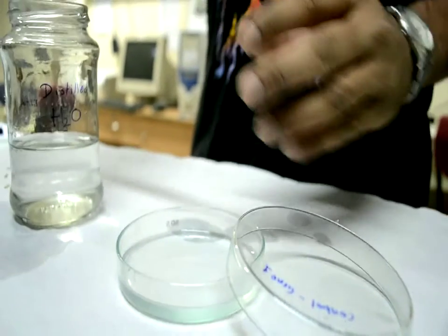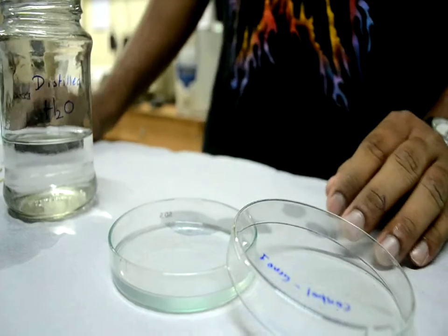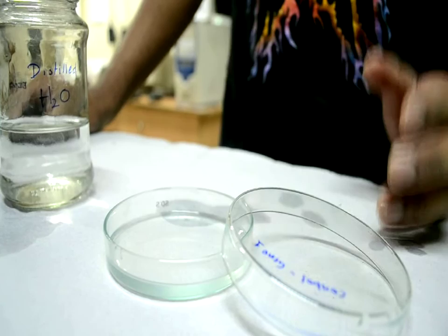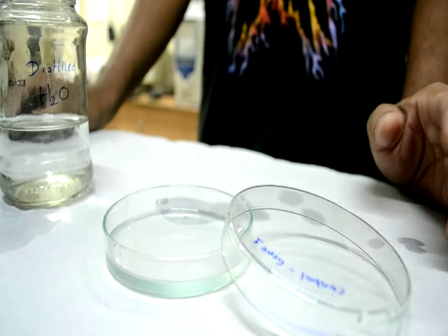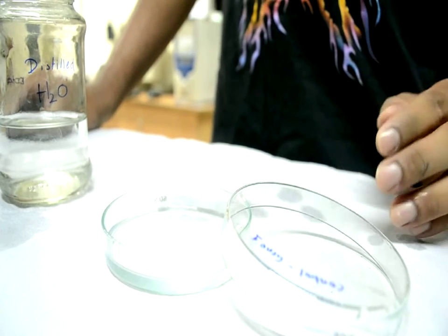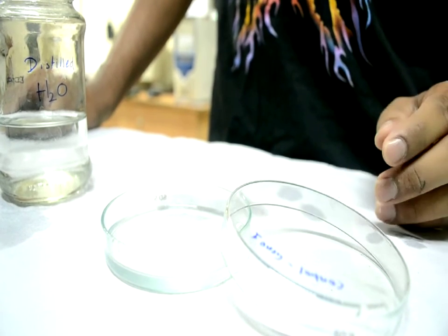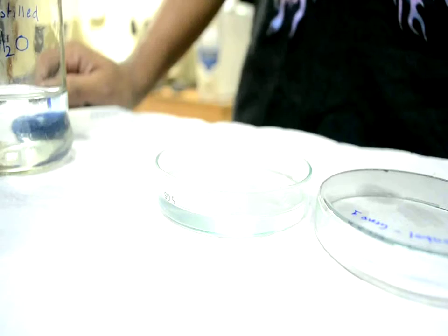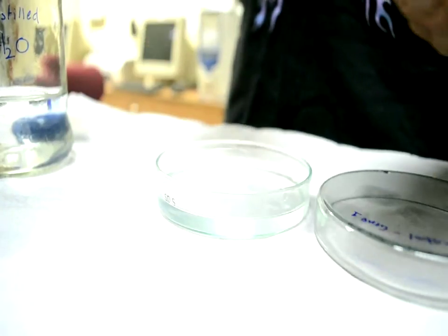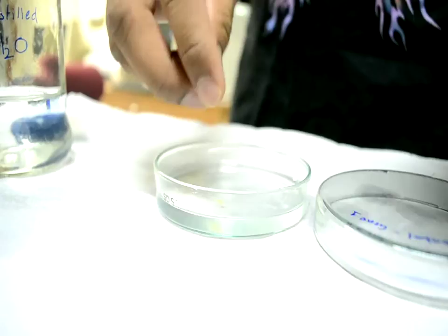For this experiment, 15 ml of water and the same volume of NaCl solution are used, because the concentration of NaCl should be constant across all genotypes to avoid variable sodium chloride concentrations. After filling the petri plates with water, seeds are placed one by one onto the plates.